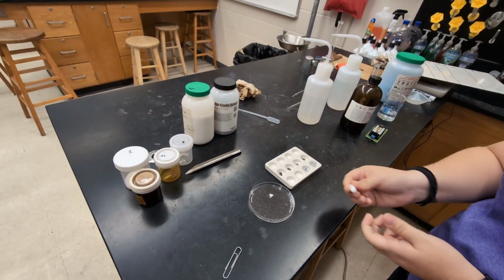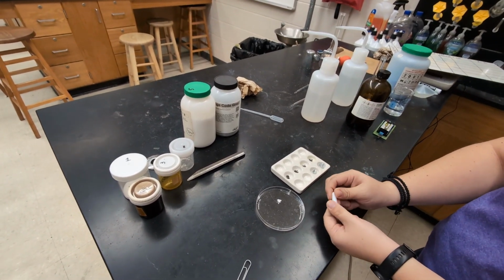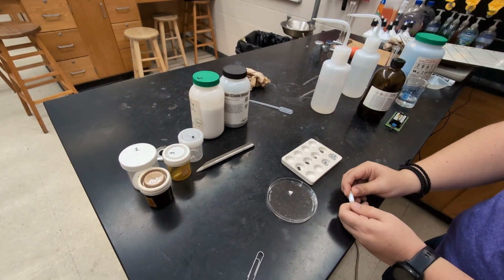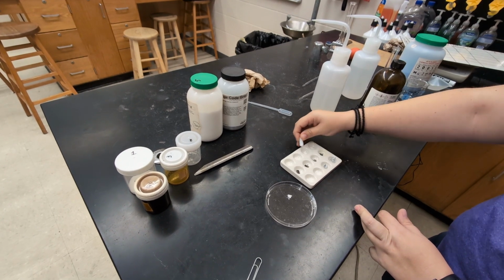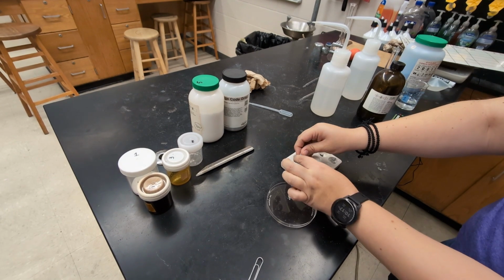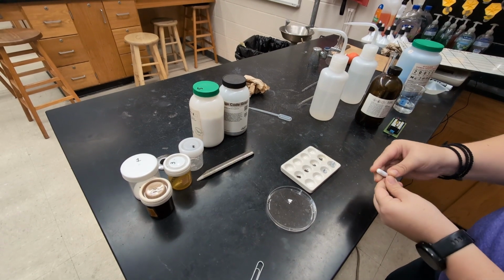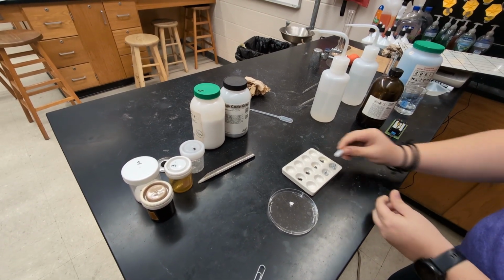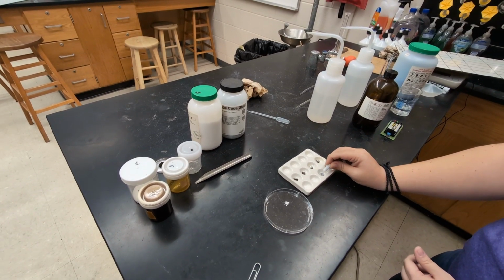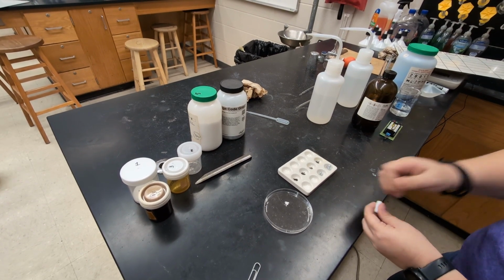Okay, our next test is to see whether it's magnetic. I just have a little stir bar that I'm using, but you can use a larger magnet if you have it. I'm just going to place it over and see if it attracts. Oh, that one attracts really well. Use the other side so it's clean. Okay, so only this third substance was magnetic.